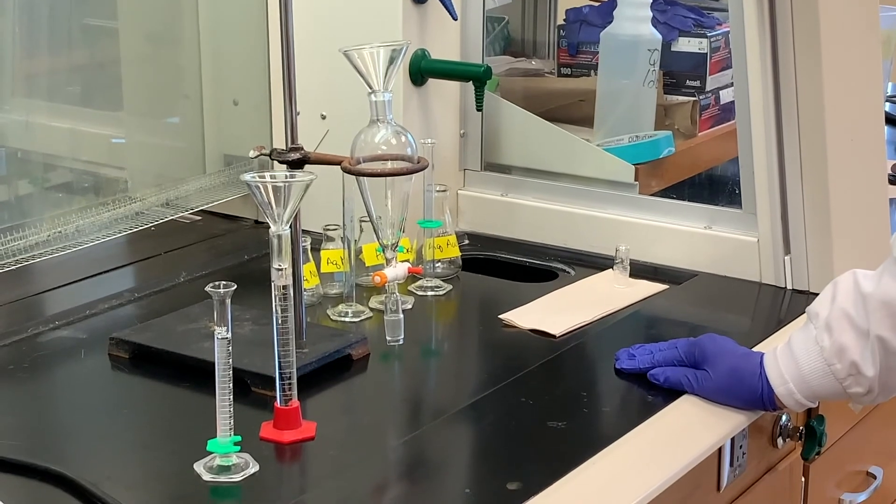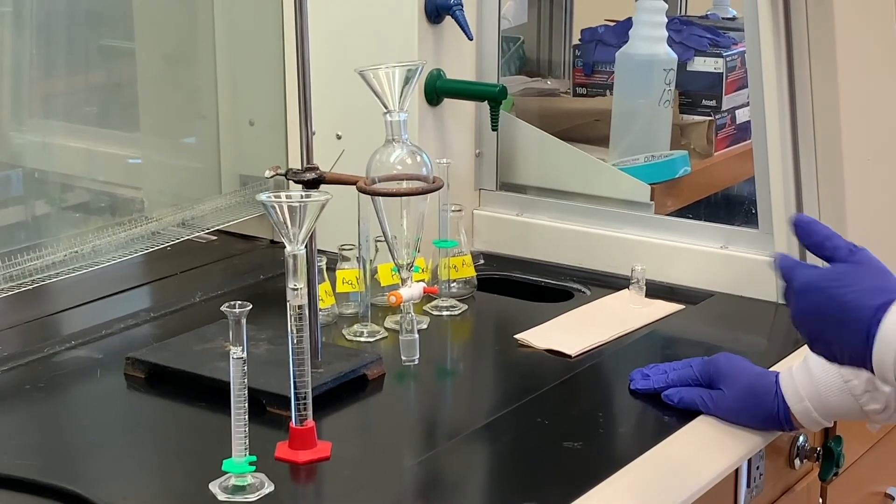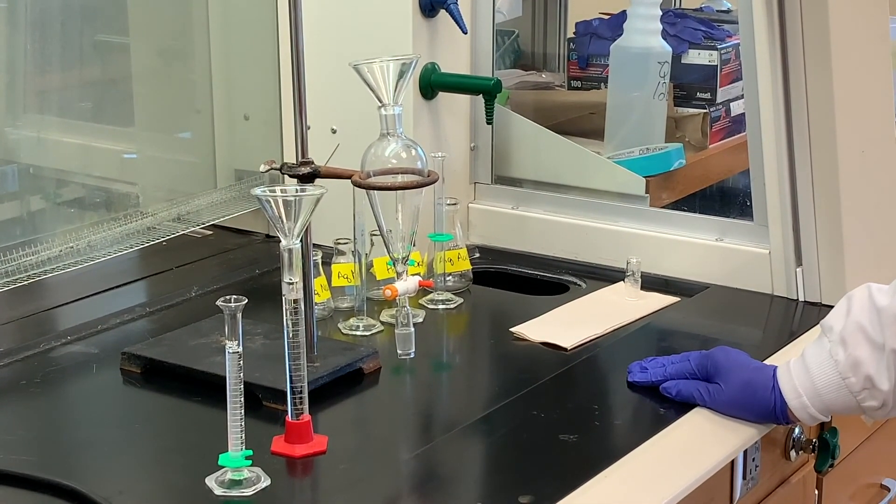The procedure, really, we're using mainly a separatory funnel to carry out most of the procedure today.